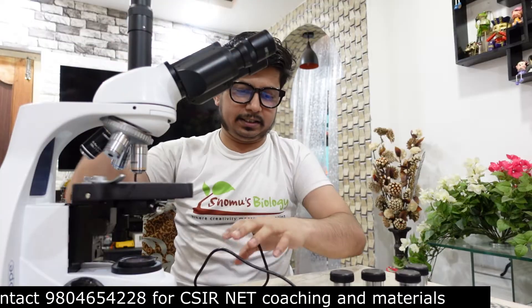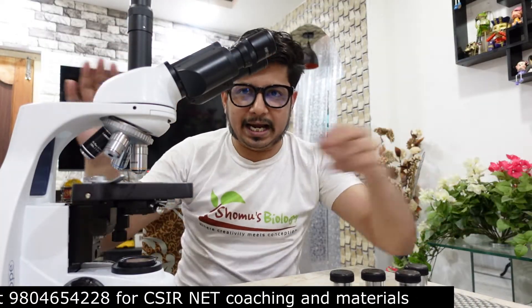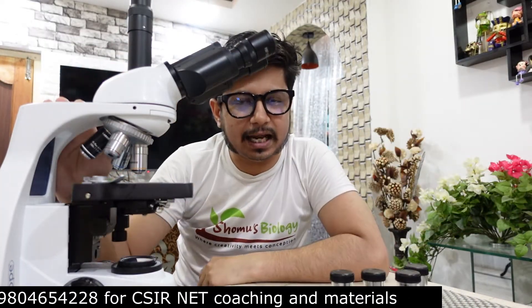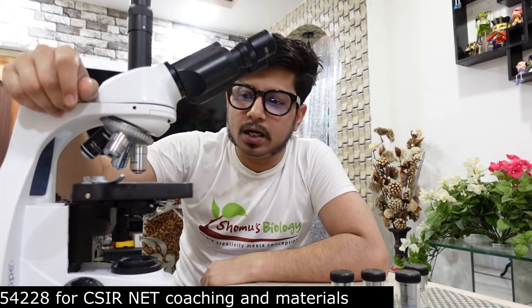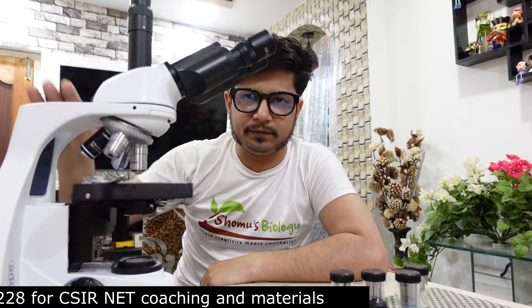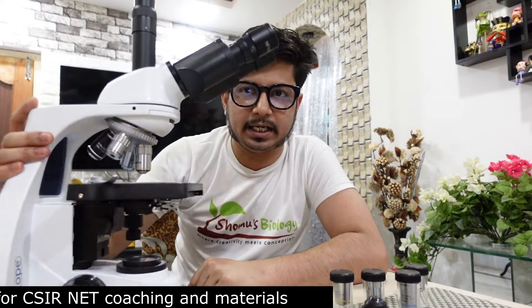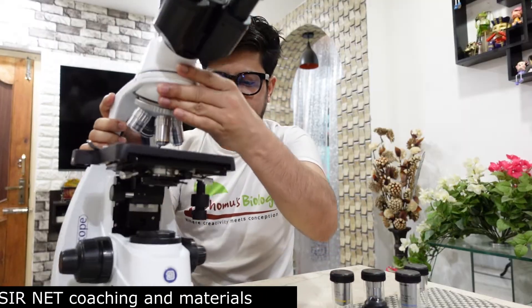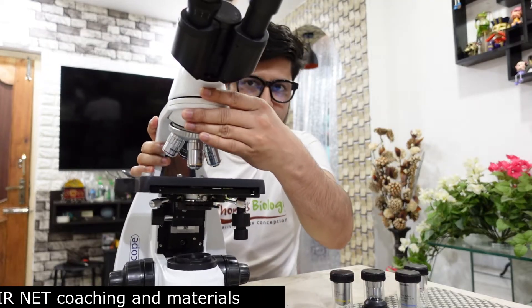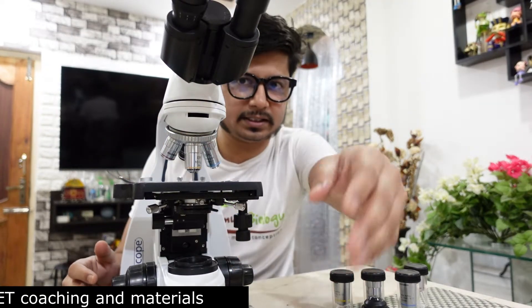Here I have a light microscope in front of me — this is the microscope I'm currently working with. I'll be telling you the different parts and components of a light microscope and what they do in real life. This is a trinocular light microscope made of different components.